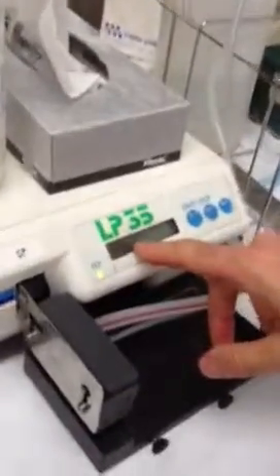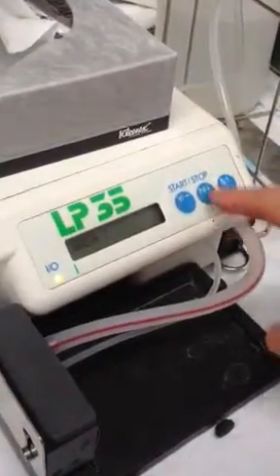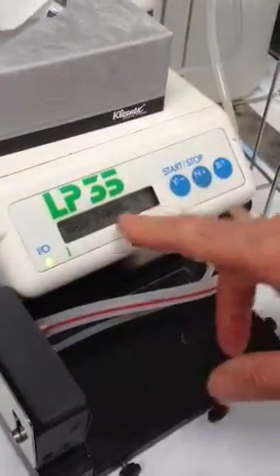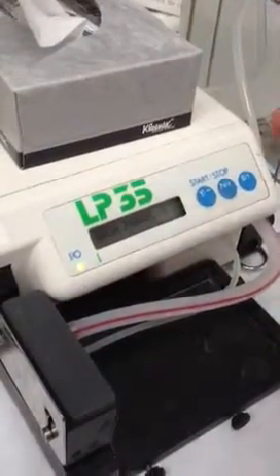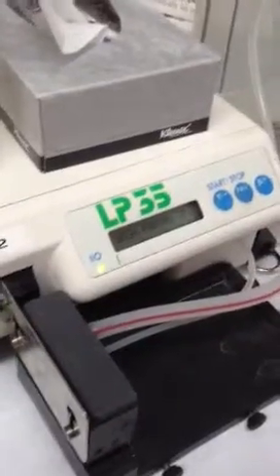So then it just comes up with instructions — wash. If you just arrow up or down, you can decide what you want to do. If you want to change to wash parameters, the wash parameters sets the times of soaks and so on. There should already be some pre-set. Have a look at the ones that are pre-set.